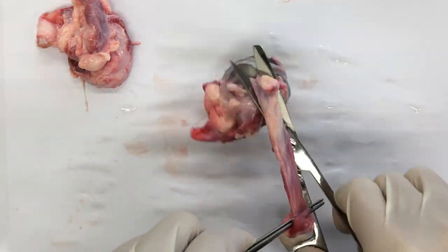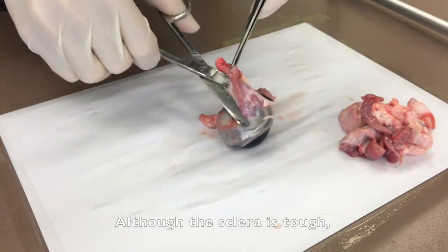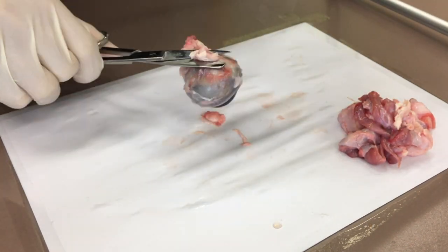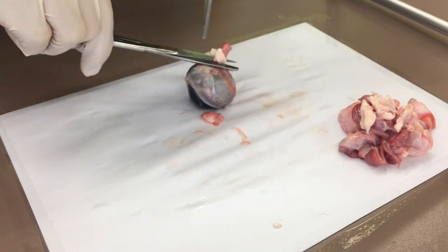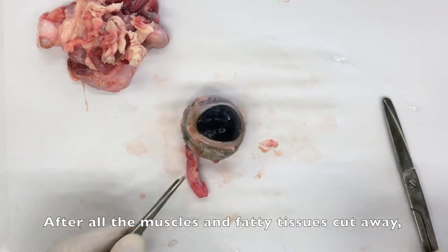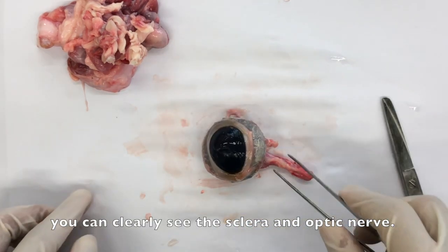Although the sclera is tough, you should also be careful in this process. After all the eye muscles and the fatty tissues are removed, you can clearly see the sclera and the optic nerve.